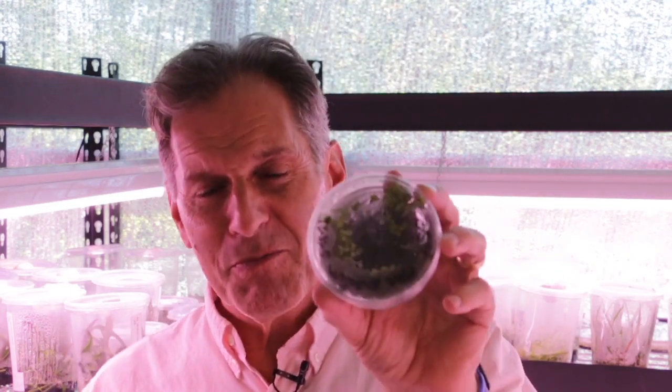It's an unusual orchid. It was given to me, and the number of embryos that are forming, the number of protocorms, are small, and they're really slow. So normally there'll be leaves on here within 3 months. And here, I'm starting to see leaf formation after 5 months. So we'll see what happens with this. I'm excited about this.